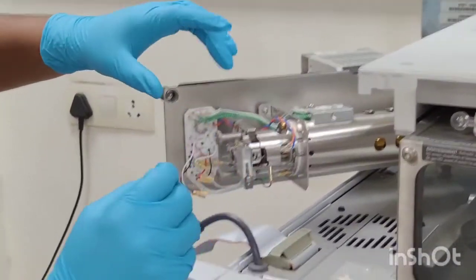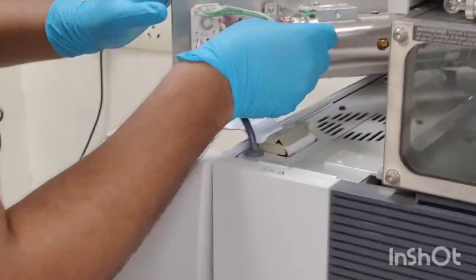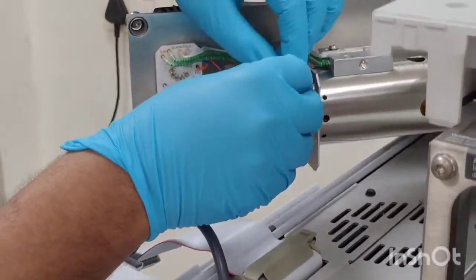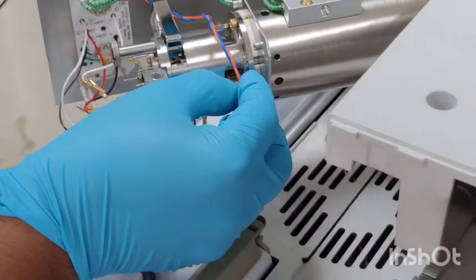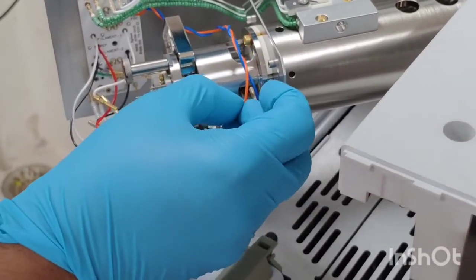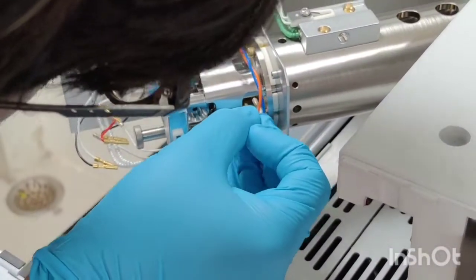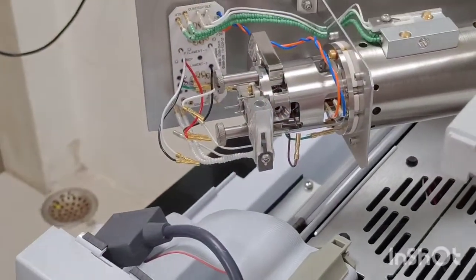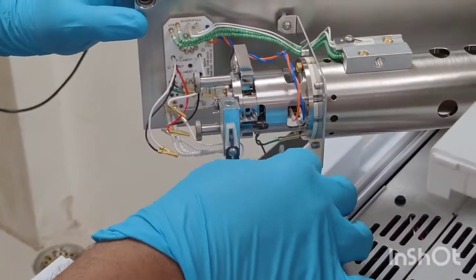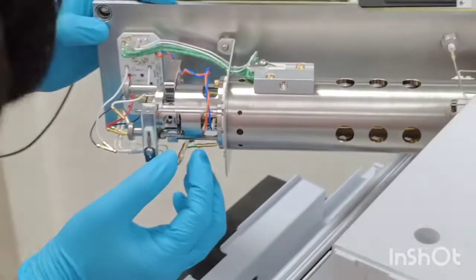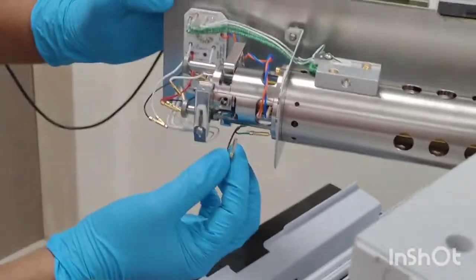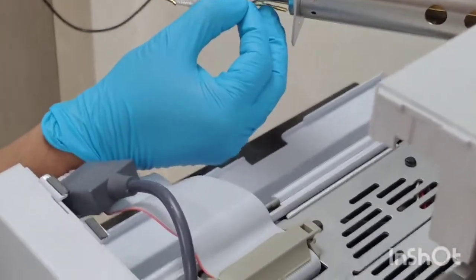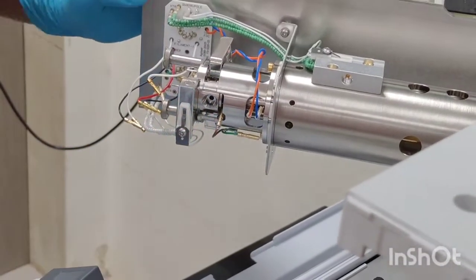As I said earlier, the blue one indicates the entrance lens which is the last part of your ion source, so blue part will be away from you. The orange part represents the ion focus, it should be towards you, we have fixed like that. This cable which is coming from below is your extractor lens and we will be fixing it like this.